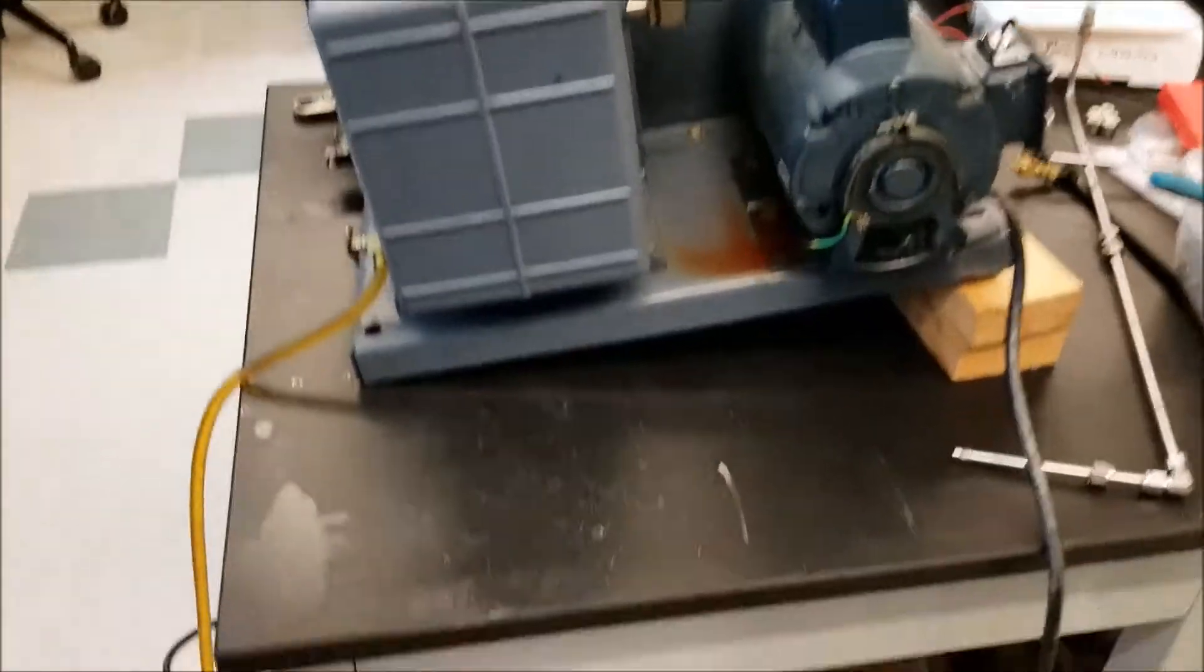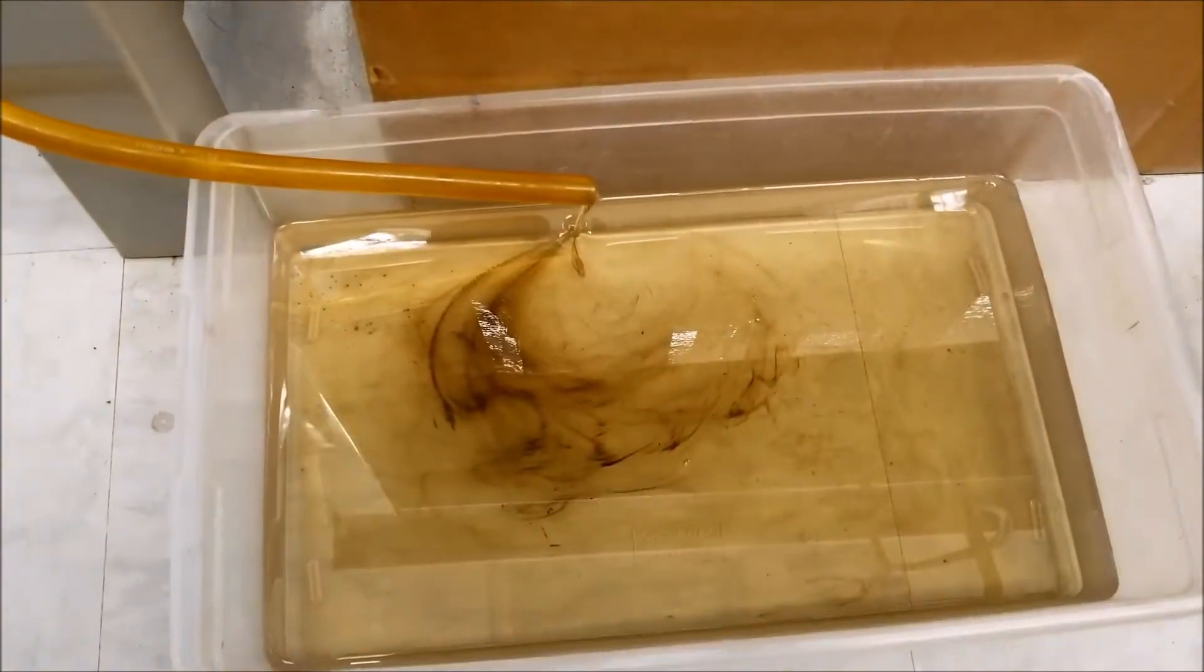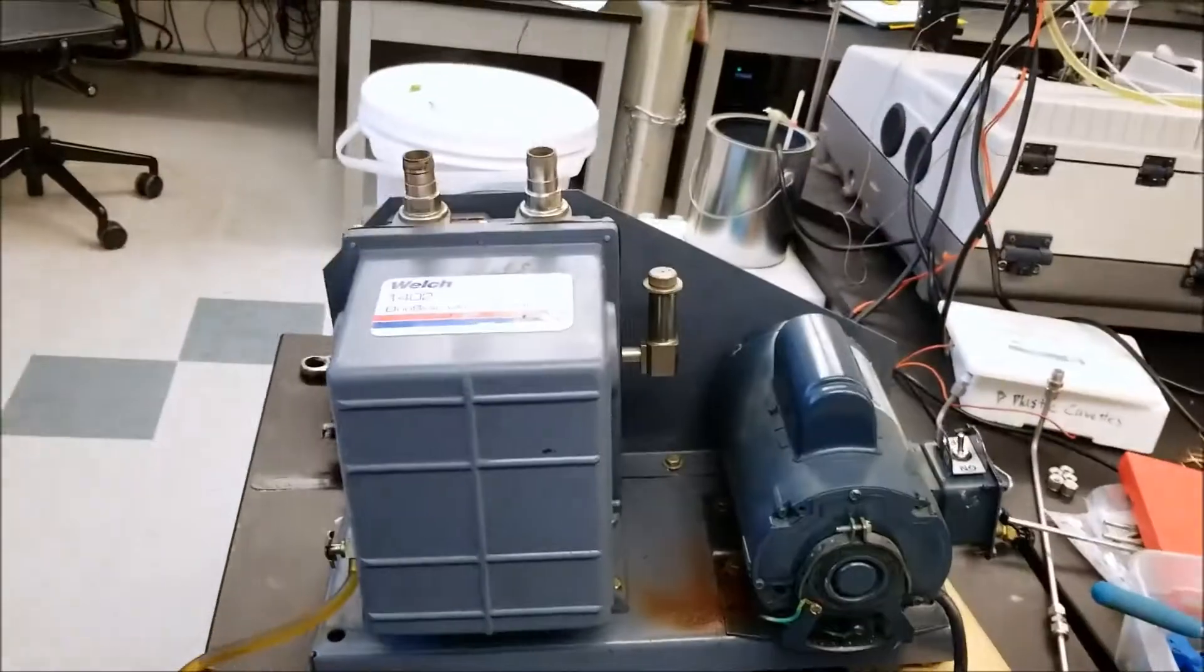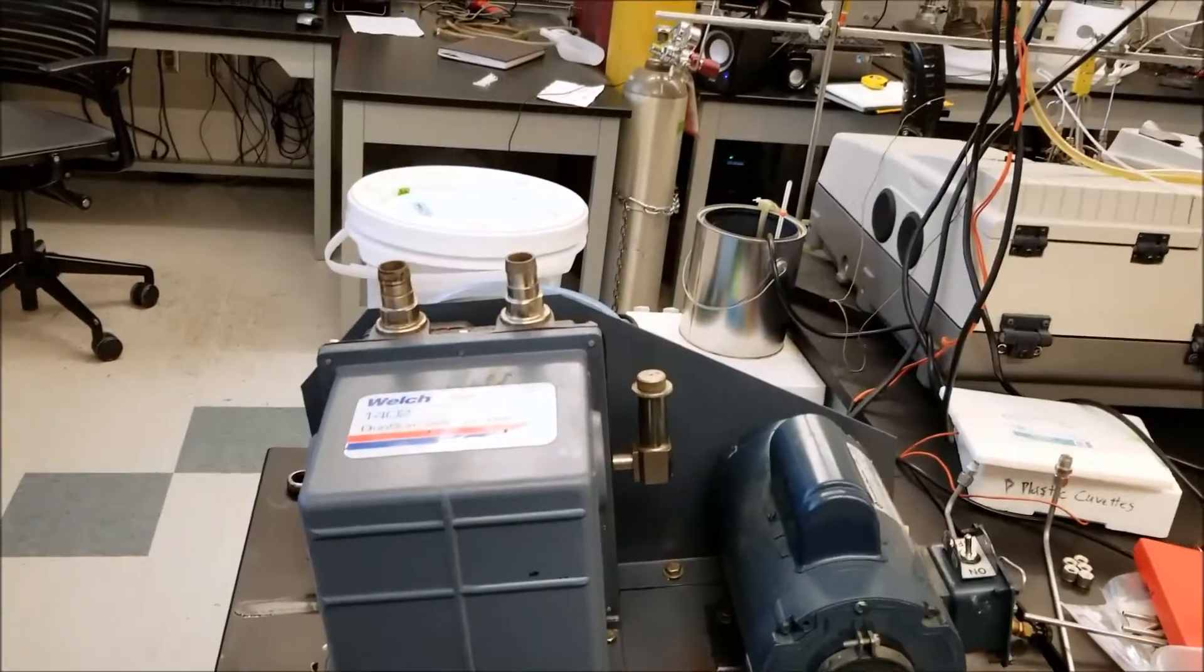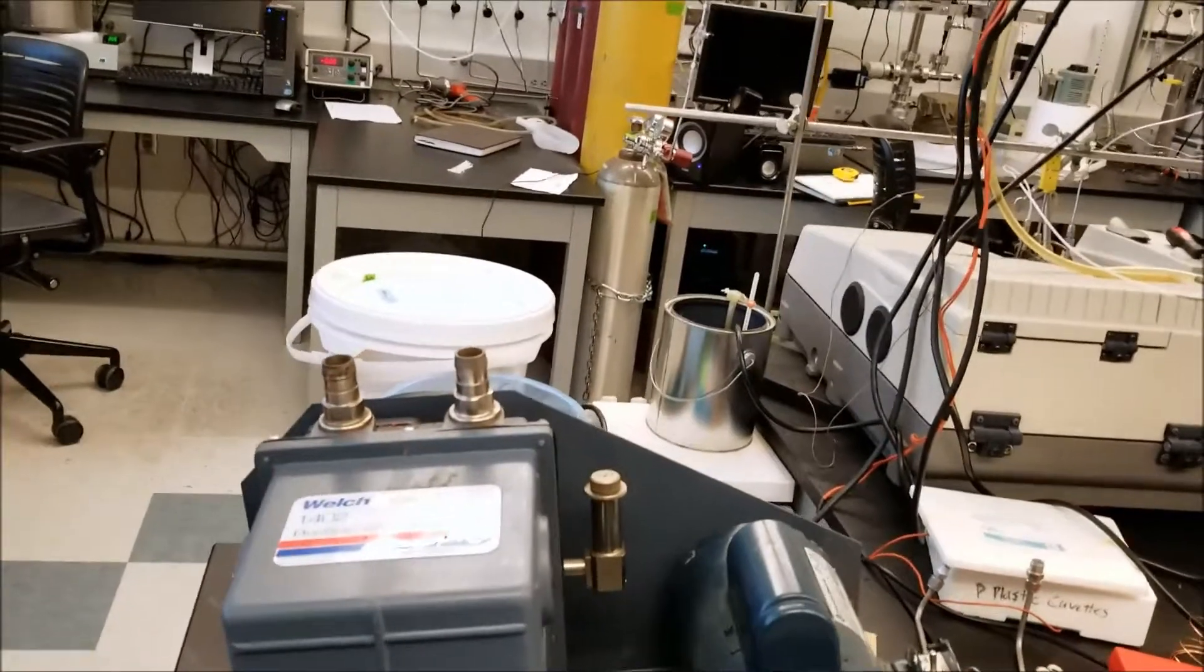Empty that and if it's still dirty, in fact as I was doing that we saw more of the darkly colored oil come out. So if you still see that, put in another cup and do this progressively to see if it'll get more and more clean.